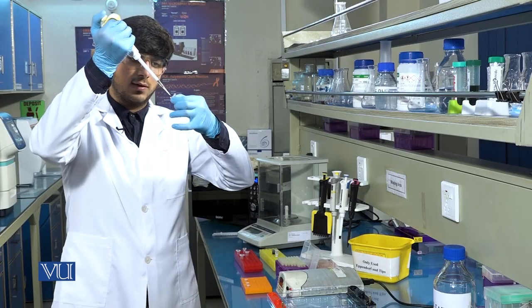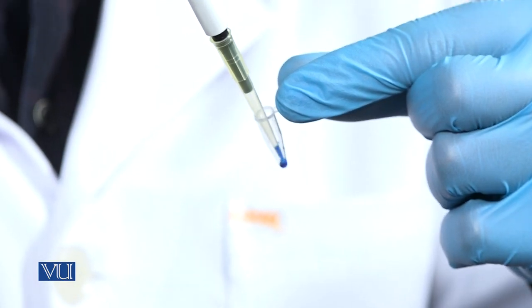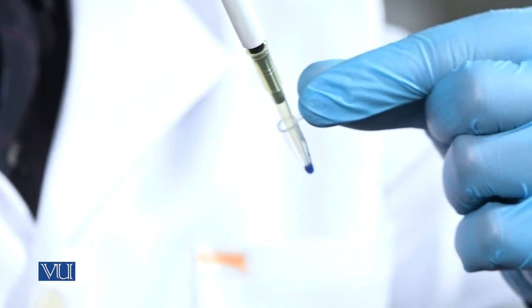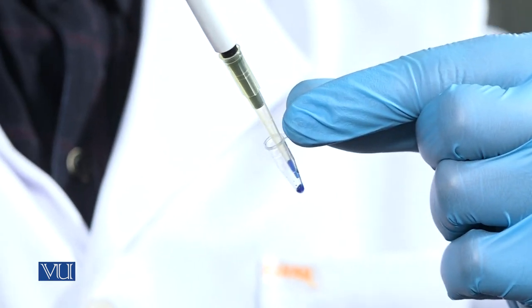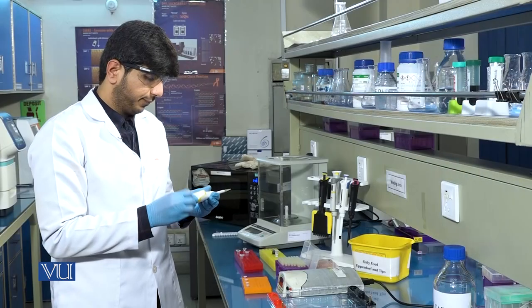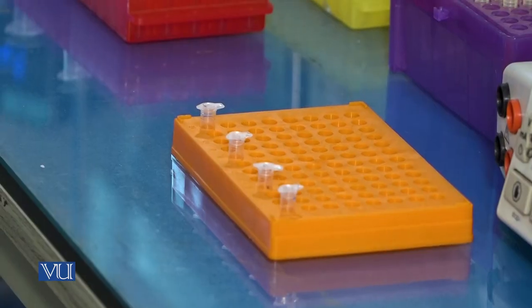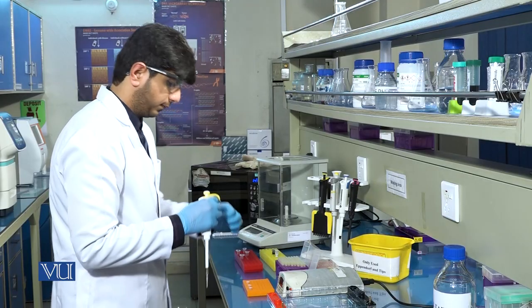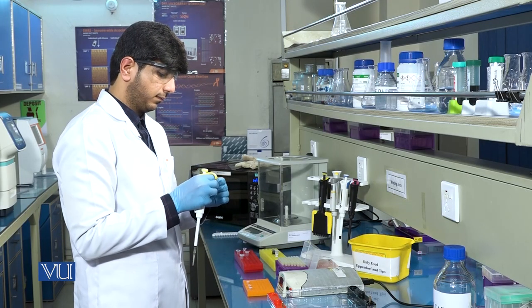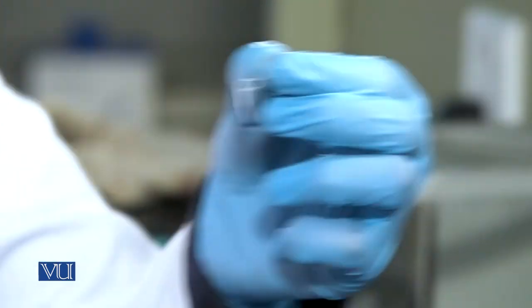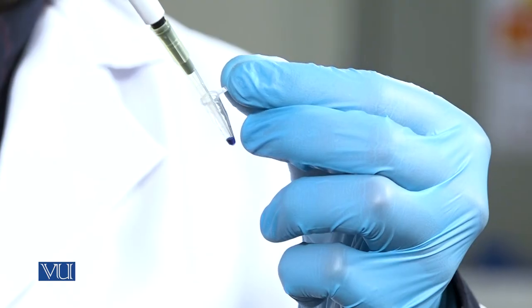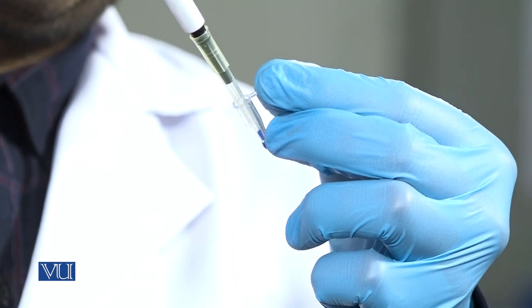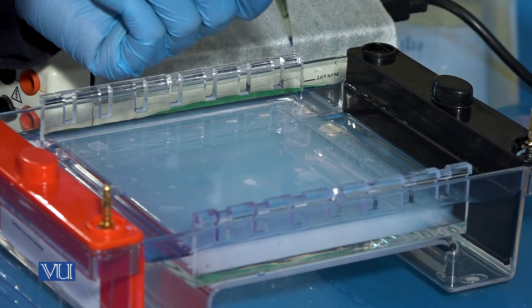Mix the DNA with loading dye with the help of pipette and load the sample in the gel.